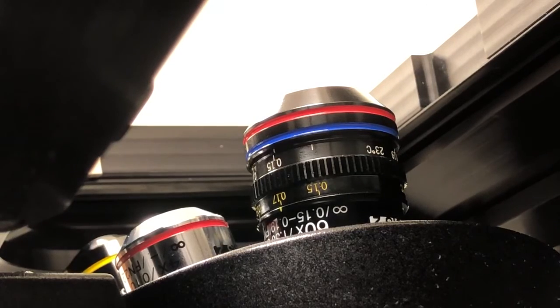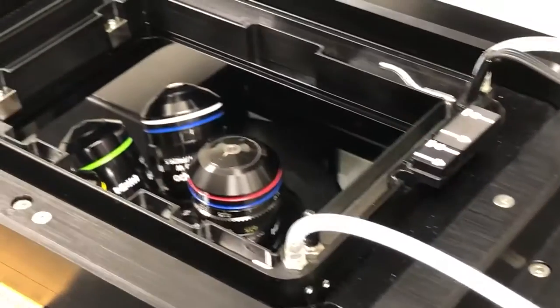You can see that's the case, so now this objective is set correctly for imaging at 37 degrees. I am now going to put the sample holder back into position.